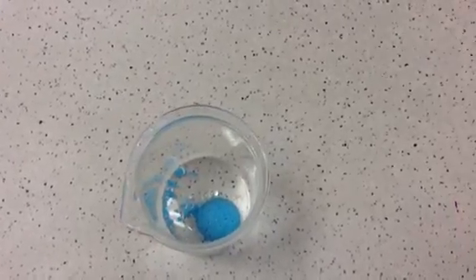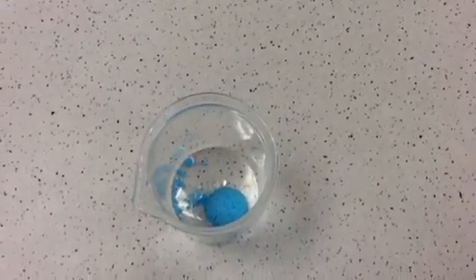Think about why this is a reversible reaction. So at the beginning we had hydrated copper sulfate, which was blue. We heated it in the Bunsen burner for about a minute, and it formed anhydrous copper sulfate, which was white. And then we put it into the small beaker, we added a few drops of water with the pipette, and think about what's now happened to the copper sulfate. Why is this a reversible reaction? Have a think about it, and then we'll have a look at your answers.